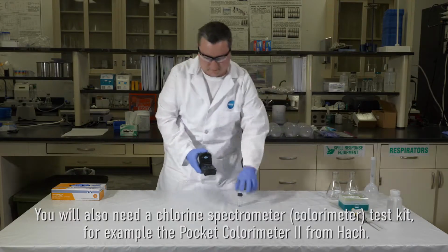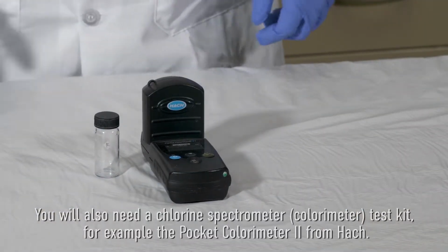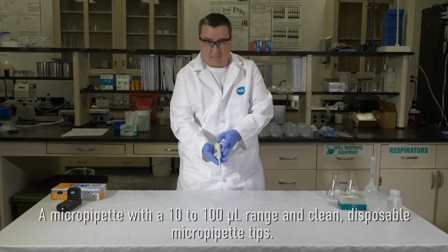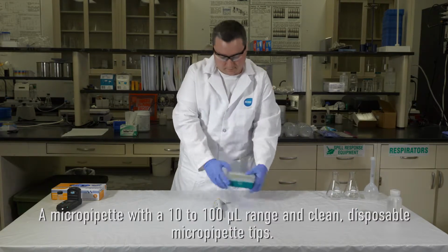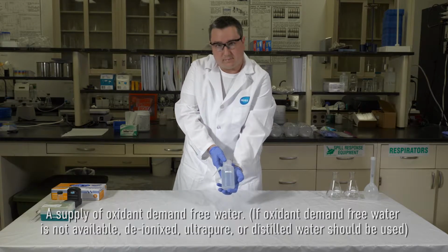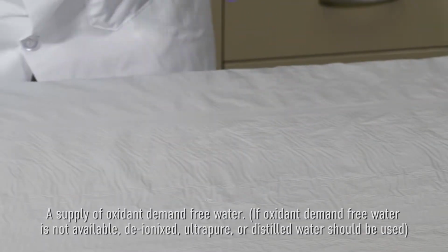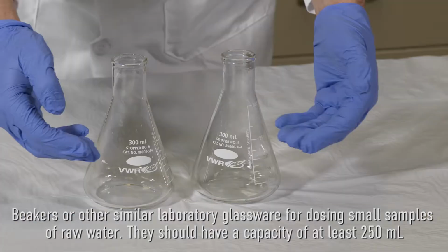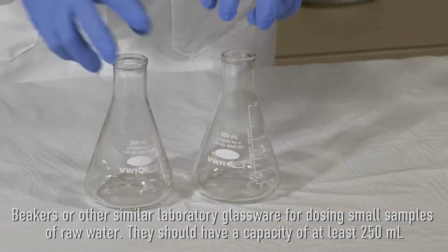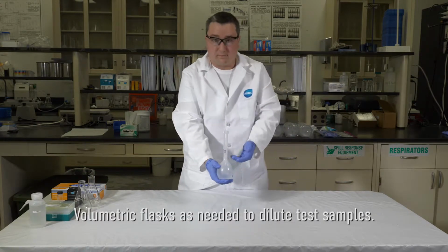A chlorine spectrometer colorimeter test kit, for example, the Pocket Colorimeter 2 from Hach. A micropipetter with a 10 to 100 microliter range and clean disposable micropipette tips. A supply of oxidant demand-free water. If oxidant demand-free water is not available, deionized, ultrapure, or distilled water can also be used. Beakers or other similar laboratory glassware for dosing small samples of the raw water. These beakers should have a capacity of at least 250 milliliters. Volumetric flasks as needed to dilute samples.